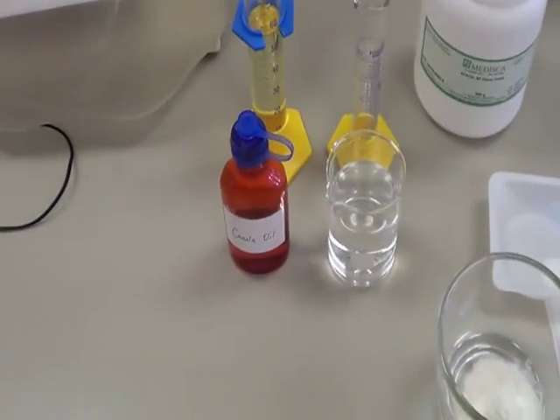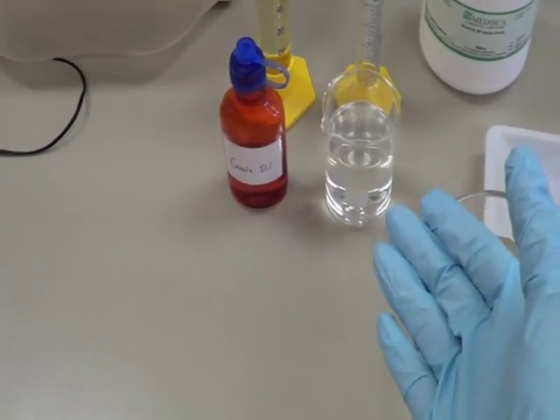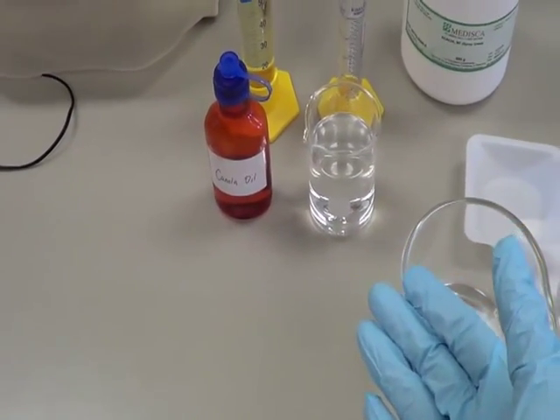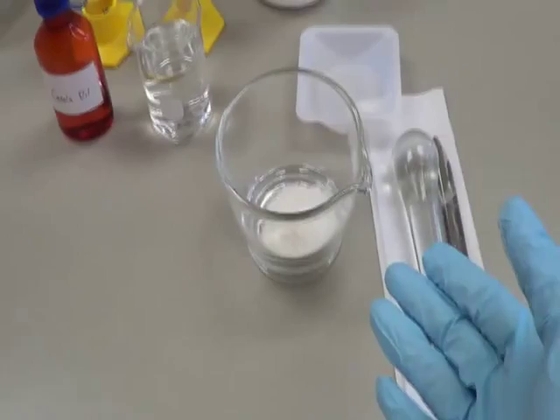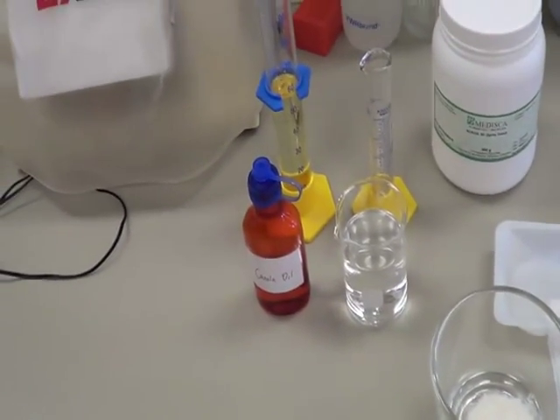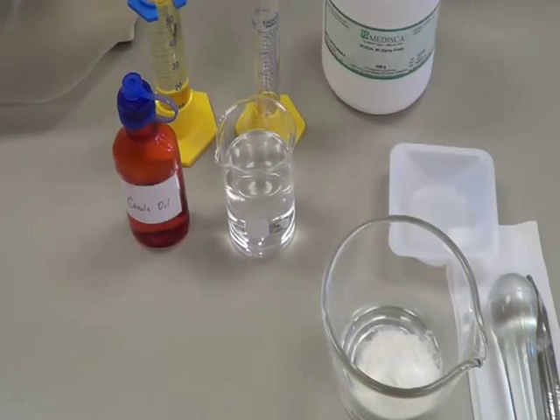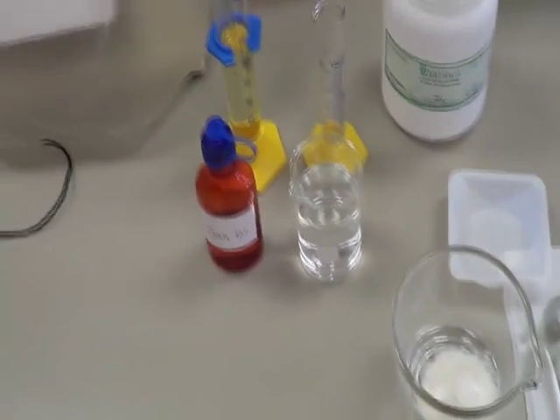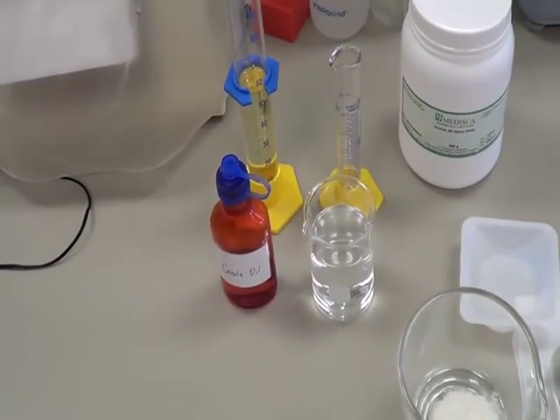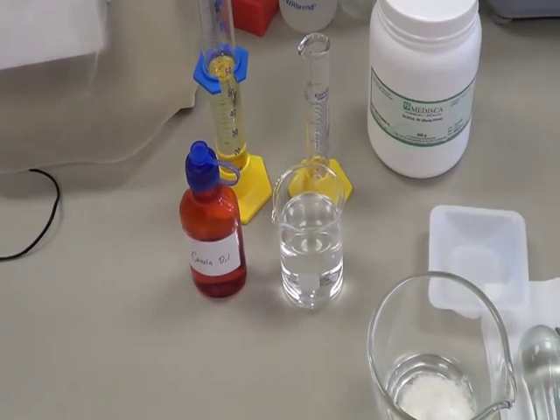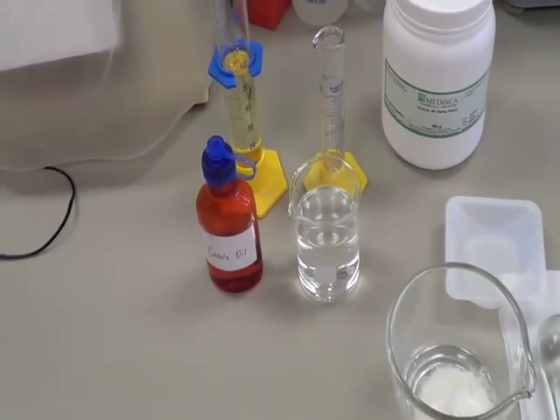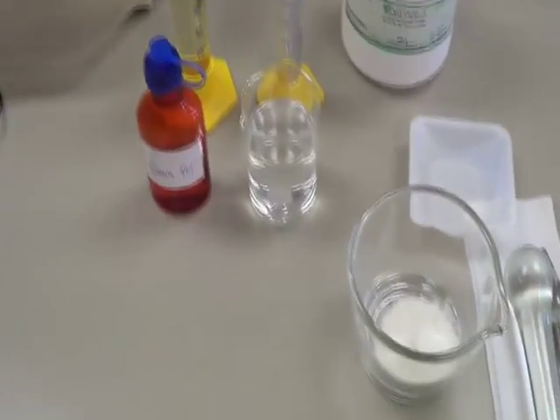By the way, here is a question. Water and oil are in liquid form and acacia is in powder form. So how are you going to calculate the ingredients, the amount you need for 100ml of emulsion? You calculate based on your experience. Alright, so let's get started.